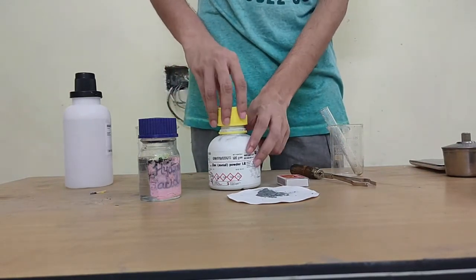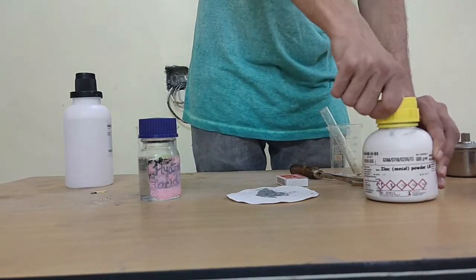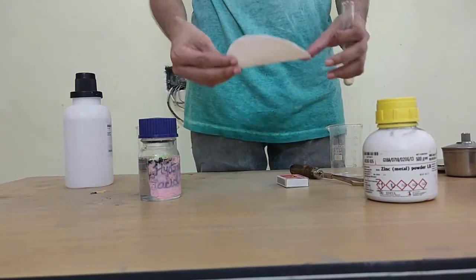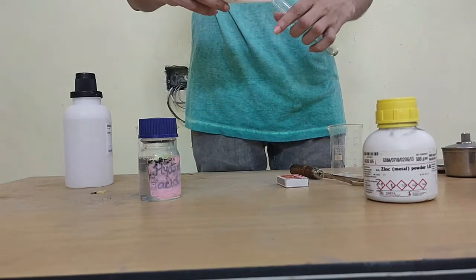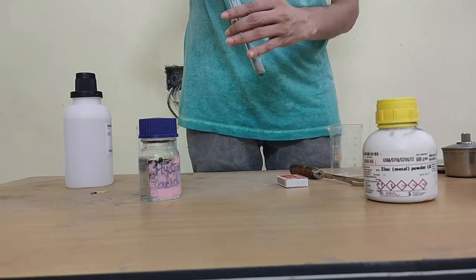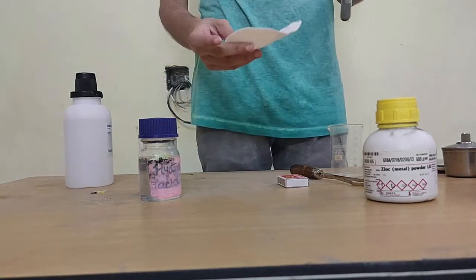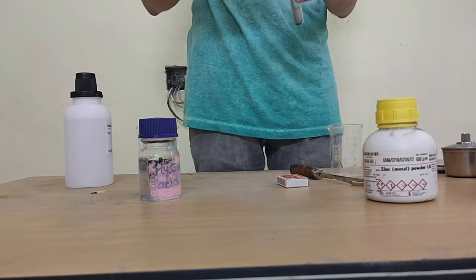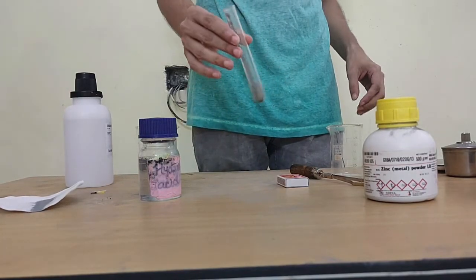Now what I will do, first thing, I'll take this metal and I will pour it directly into our test tube. Okay, here's our test tube, here's our metal. I've used the paper just for convenience, so I can directly pour the metal inside of the test tube, something like this. Simply a matter of convenience. Again, that's why I didn't mention filter paper as apparatus. It's not a part of the apparatus or the equipment we need. Okay, so now I have poured my metal inside of my test tube.